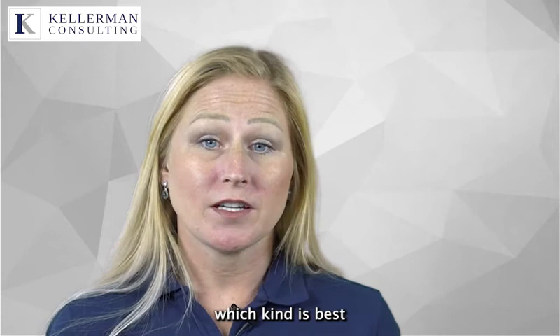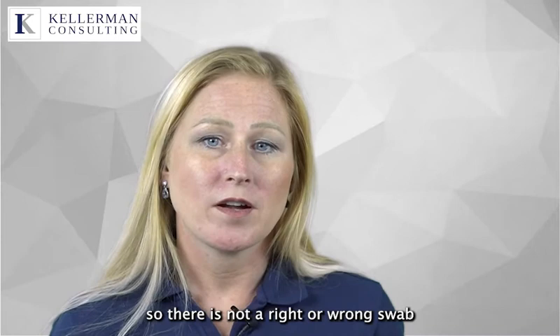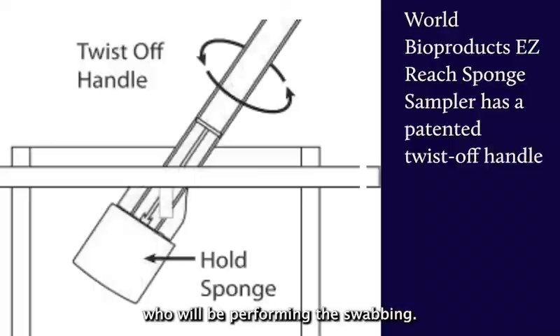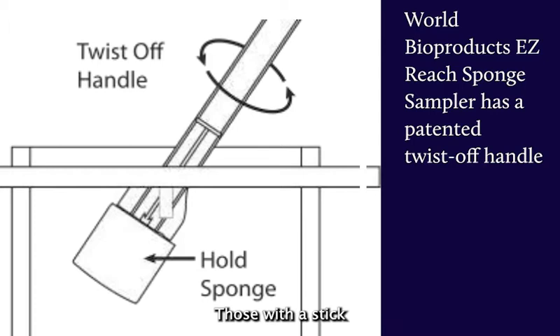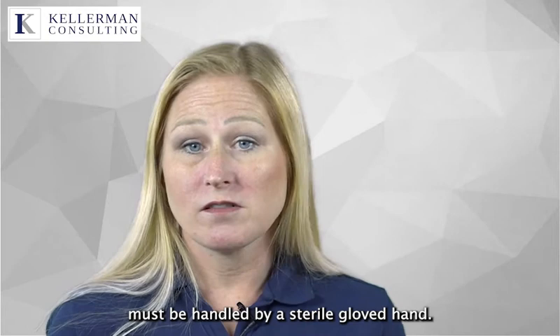Now let's look at the actual environmental swabs to determine which kind is best for conducting the swabbing. Swabs come in two main types: those with sticks attached to them and those without sticks. The swabs work the same way, so there is not a right or wrong swab from a testing standpoint — only an ease of use for the employees performing the swabbing. Those with a stick are held by those sticks during use, while swabs without sticks must be handled by a sterile gloved hand.